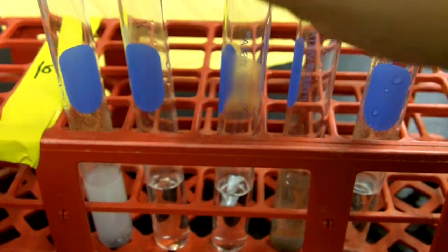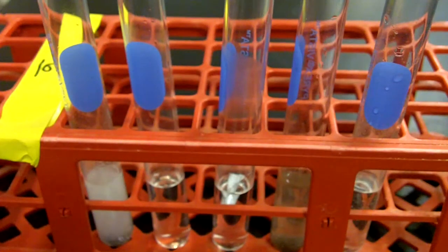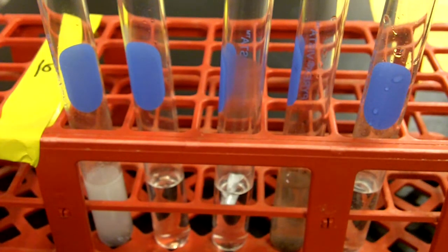So bubbles were seen for the zinc, the aluminum, the iron, and the magnesium. Heat was noticed for the magnesium especially, but also for the zinc. No heat for the iron nor the aluminum, but bubbles, although slow in their formation and small, did occur. And that completes the video for the makeup for the lab single displacement reactions. Be sure to address the analysis of data and the conclusion before turning in your lab.